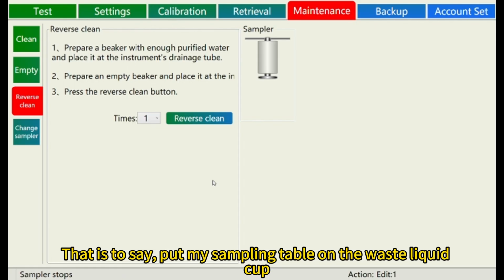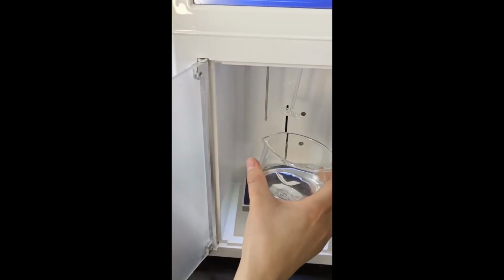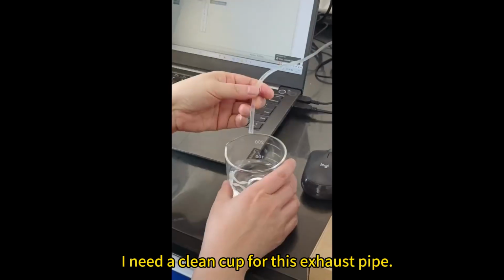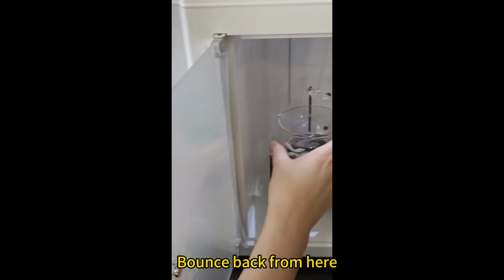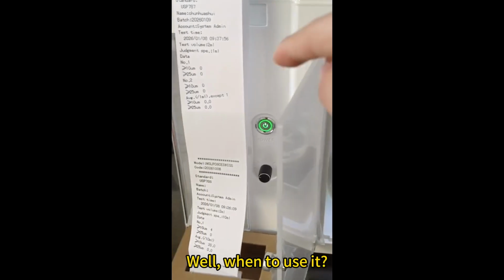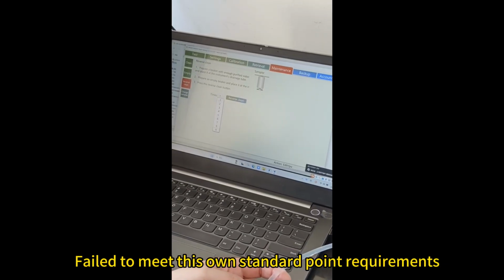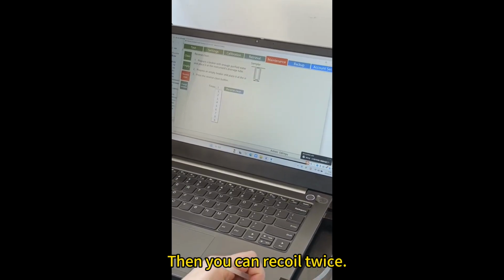That is to say, put my sampling table on the waste liquid cup. And then what about my drain? I need a clean cup for this exhaust pipe. That is to say, the wastewater comes from here and bounces back from here. It's called recoil. Well, you want to use it in the case that my data is not easy to wash and failed to meet the standard point requirement, then you can recoil twice.